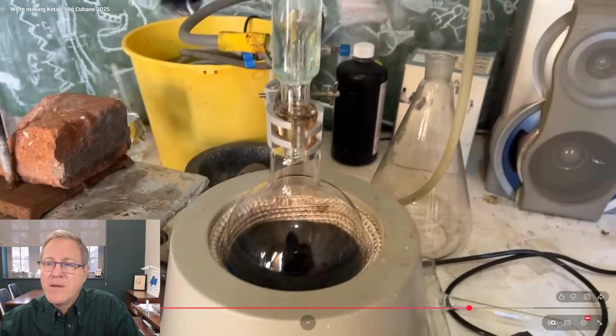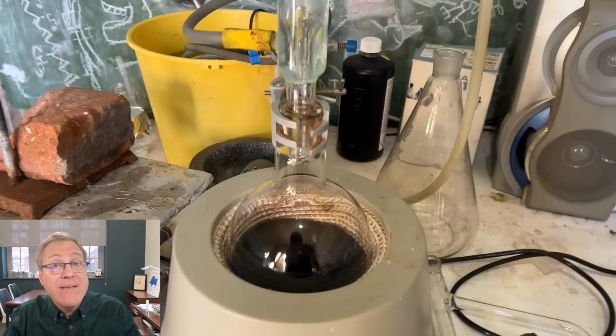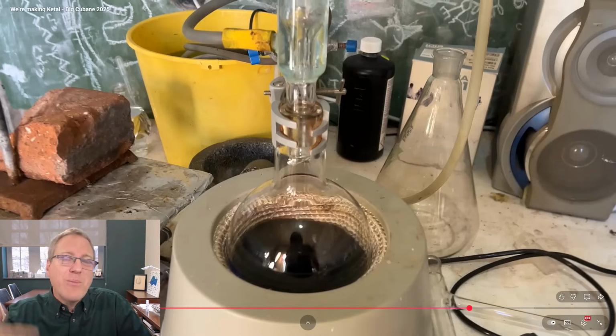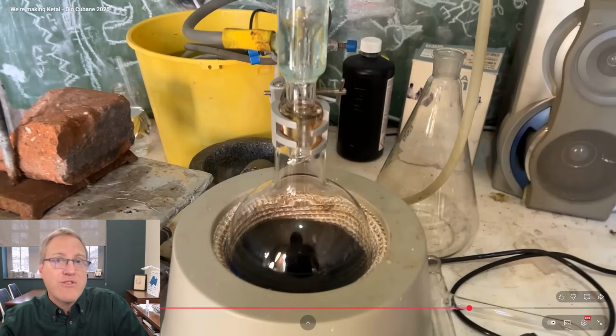He still has his acid in there. He needs to get rid of that acid. As long as the acid is present, this reaction can continue. And so there comes a point in a reaction where you want to stop it. So he is going to quench this reaction. He's going to quench the reactivity of the acid by adding some base that will neutralize that acid. And then any reactions will be completely stopped, and then he can manage getting his pure material out of there. Some people call this a quench. It's a little strong of a term maybe, but he's stopping this reaction by neutralizing the acid catalyst.